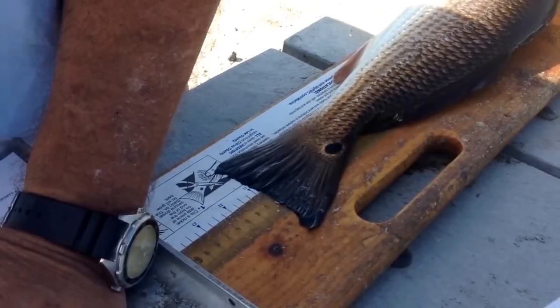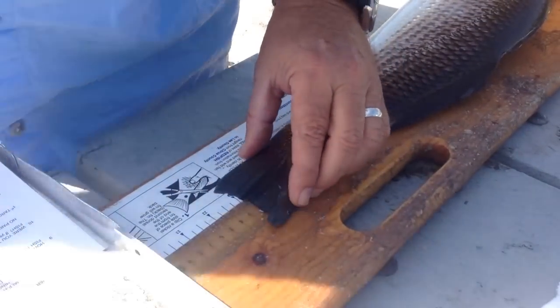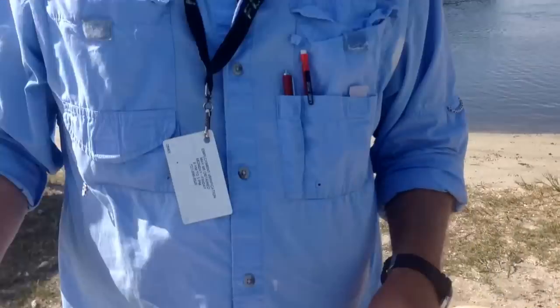And then pinch tail is 541. The main measurement we're interested in is basically the midline on the fish, but for the red drum it's best to get all of the measurements.